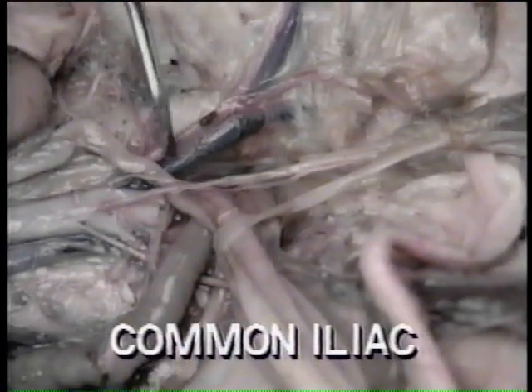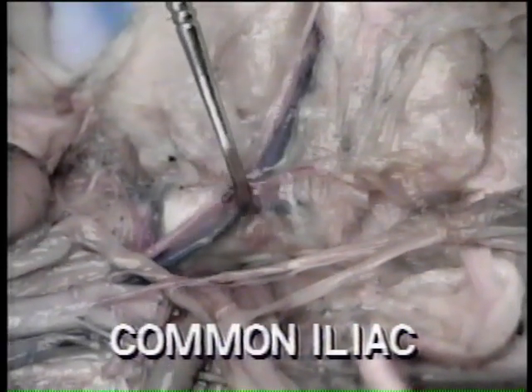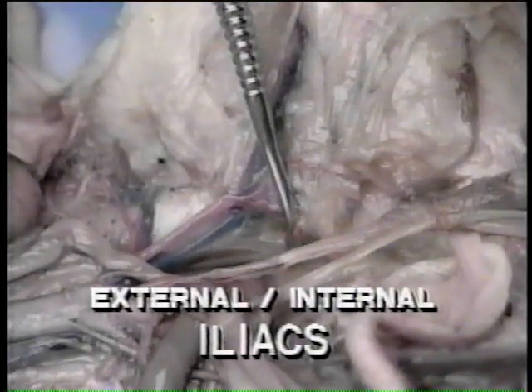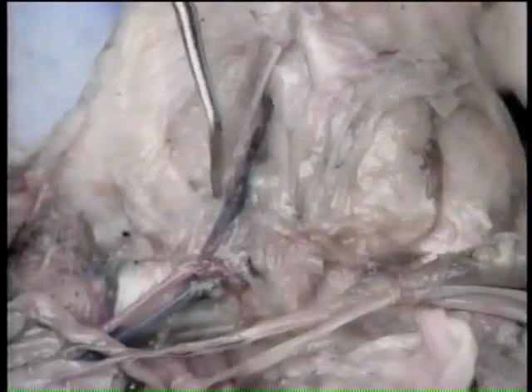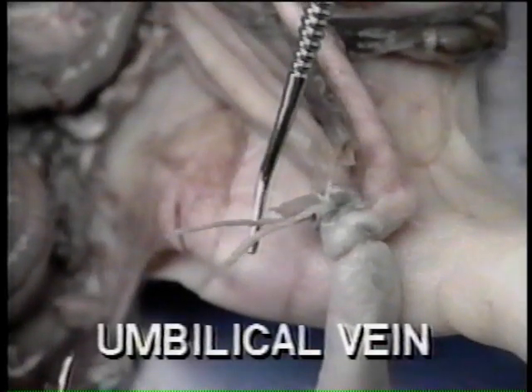Common iliac veins are the paired vessels forming the major caudal vessels. The external and internal iliac veins are the continuation of the common iliacs and receive blood from the femoral veins and the pelvic viscera. The umbilical vein is the vessel you tied pieces of string around when the body cavity was first opened.